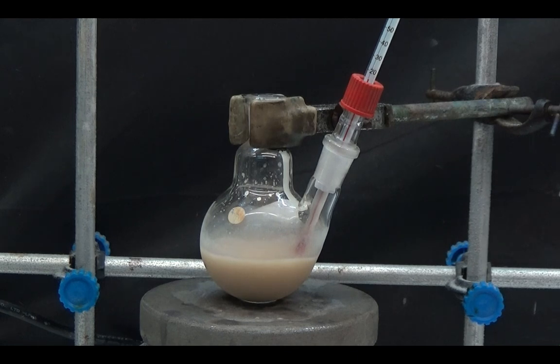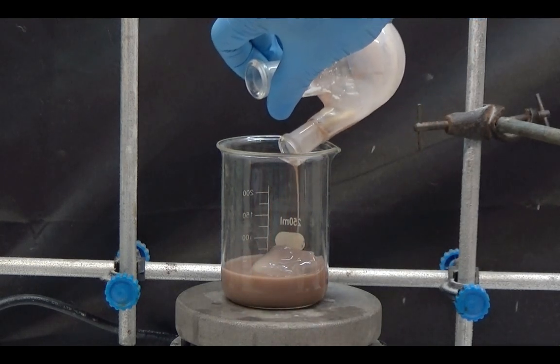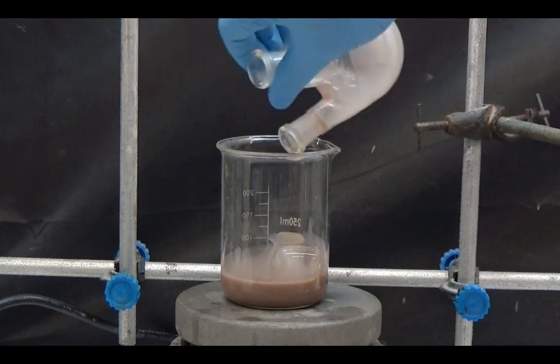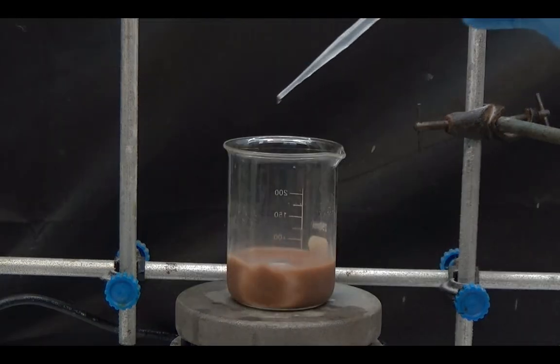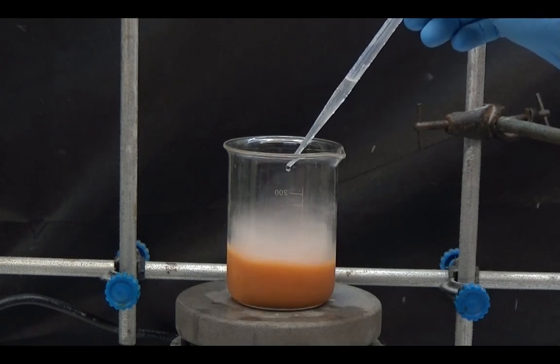The reaction turns yellow. After two hours, dump on the ice. Concentrated hydrochloric acid is used to neutralize it with stirring to a pH between 6 to 8.